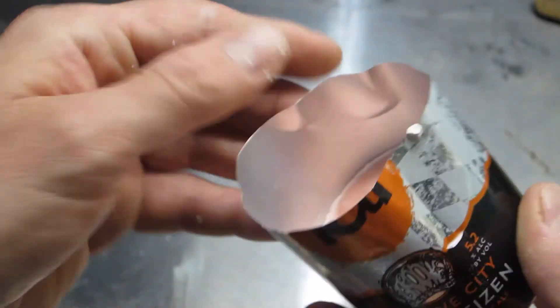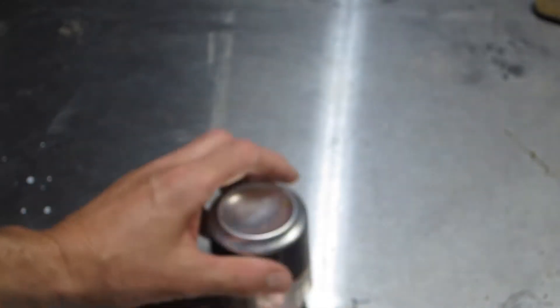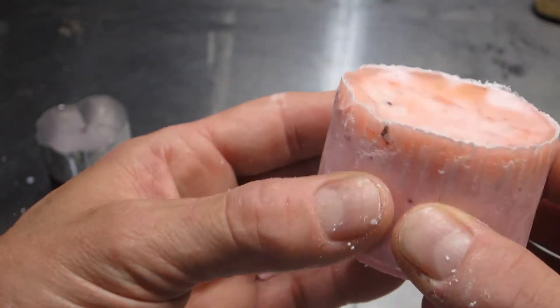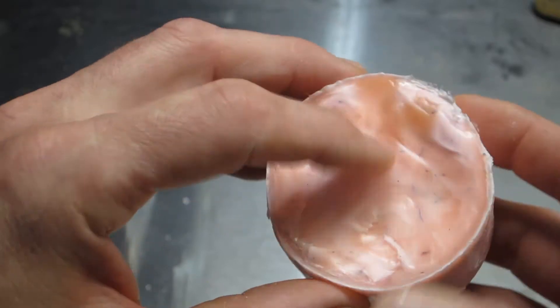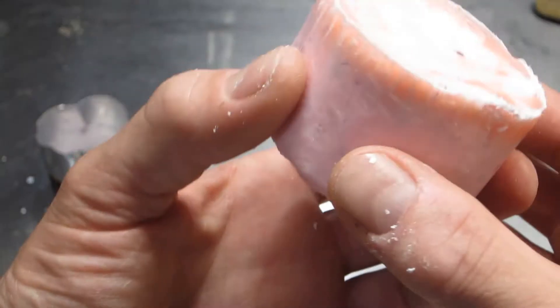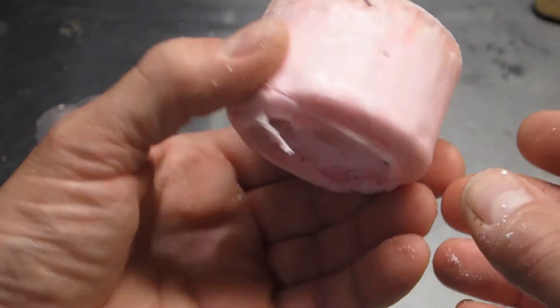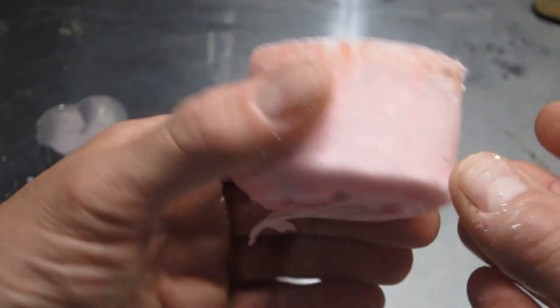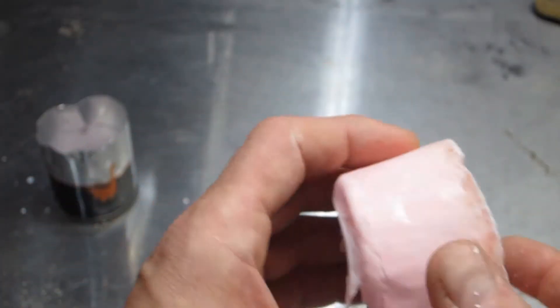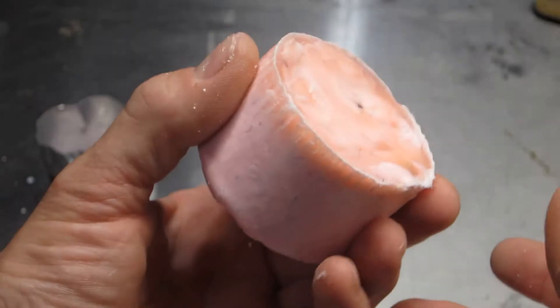This is the canned one and this has most of the mass of that experiment in it. I'm just gonna try and tap it out, there we go. Also extraordinarily light. I don't think it's completely dried all the way through so both of these are gonna be good to go in the Sun. We've got a little bit of sunshine, hopefully the heat stays up and we'll get some of this xylene driven off and see what our final product looks like. It's cool stuff though, pretty neat just as it is, although if you squeezed it real hard I think it would just turn to dust at this point. Into the Sun.